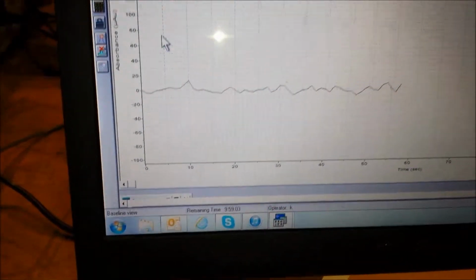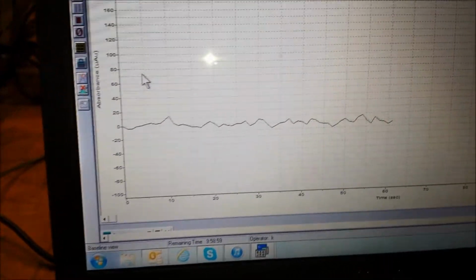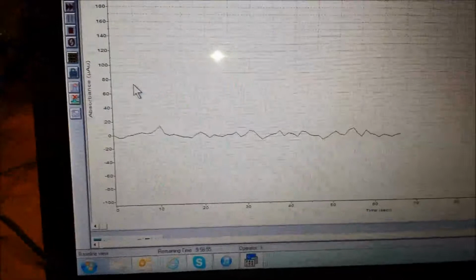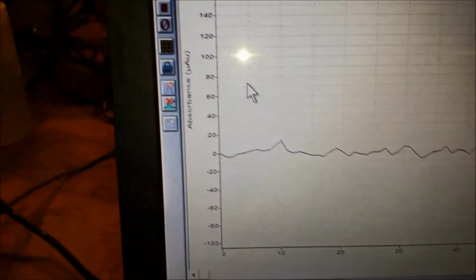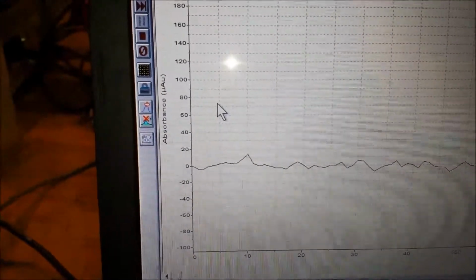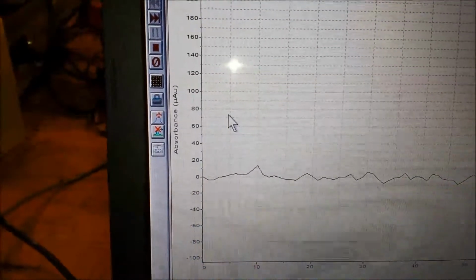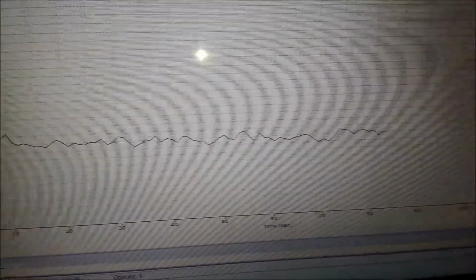One of the important factors for starting a run is making sure that the baseline is flat. This is relative to the type of chemistry you're running, but in general, you always want to start out on water. You see here you have very low numbers on the left side, 20, 40, no exponent after the microabsorbance unit, which means that you're seeing a very raw signal.